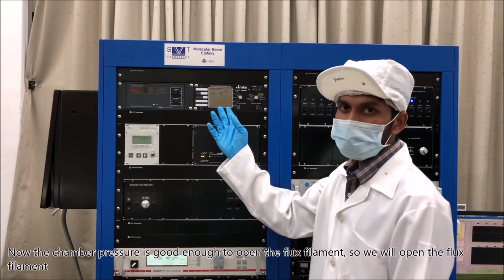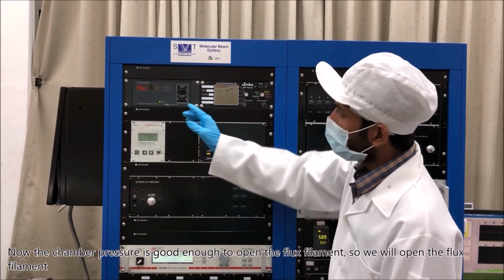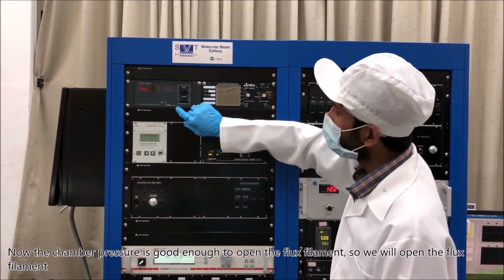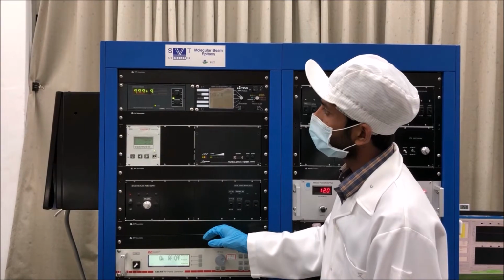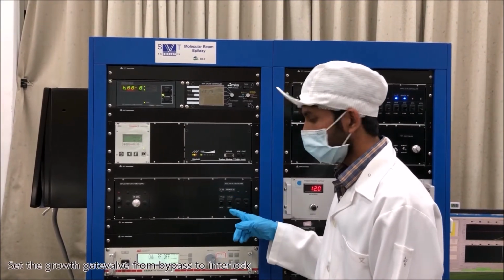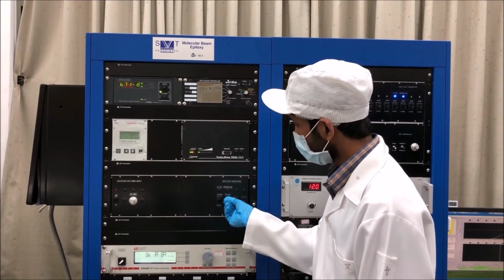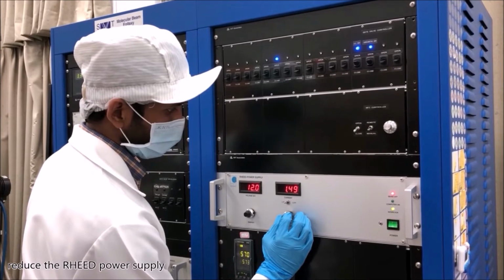Now the chamber pressure is good enough to open the flux filament. So we will open the flux filament. Set the growth gate valve from bypass to interlock and reduce the RHEED power supply.